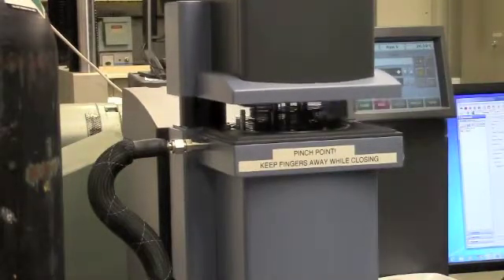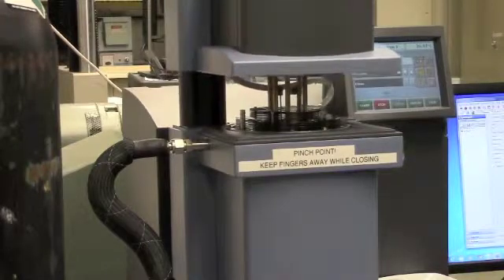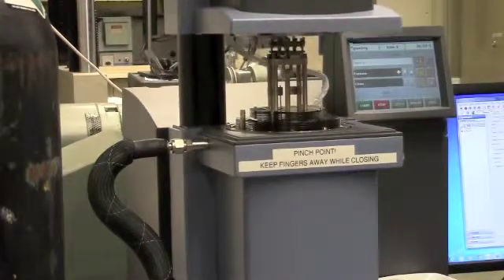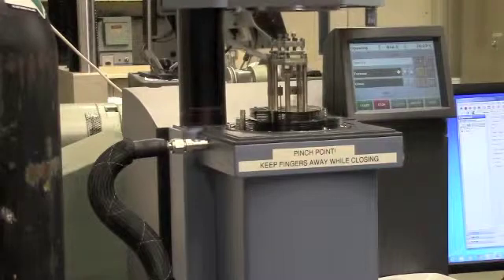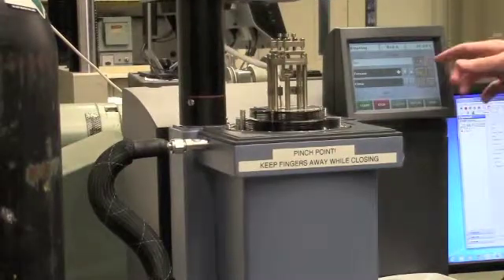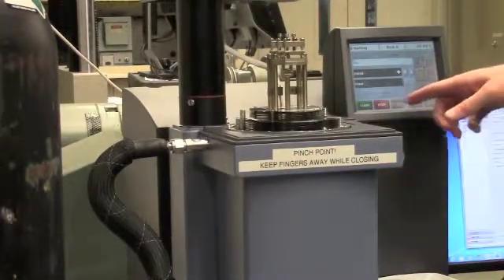Once the experiment has finished and the furnace cools enough, the sample can be removed. When removing the sample, remember to lock out the air bearing before using the torque wrench to loosen the screws on the clamp.